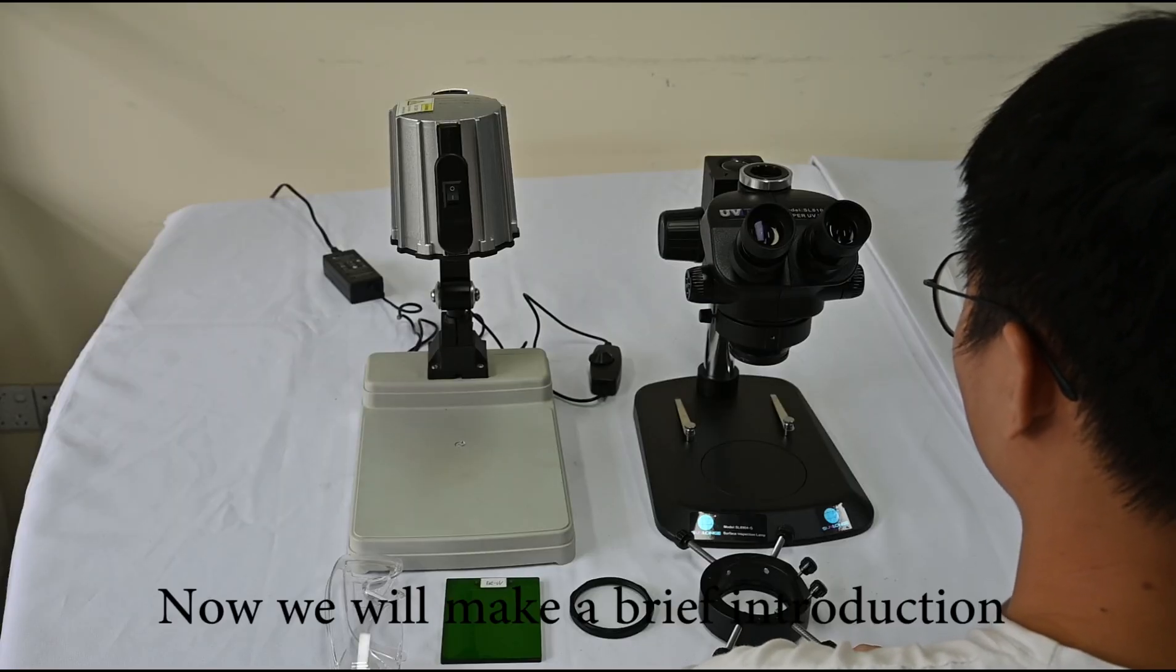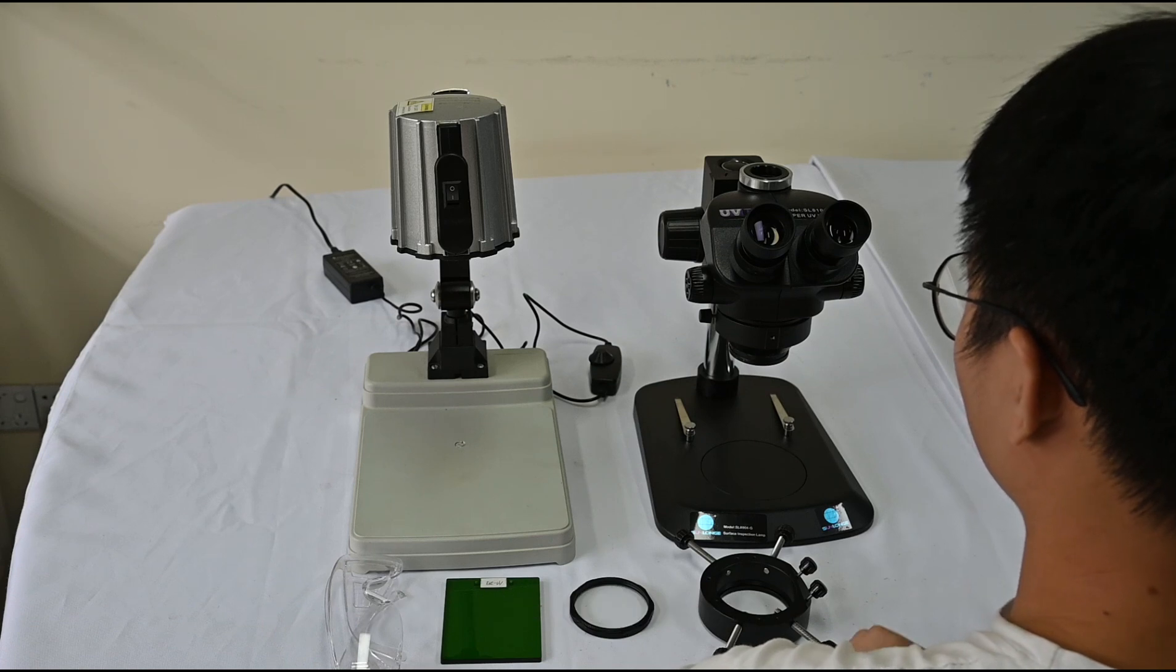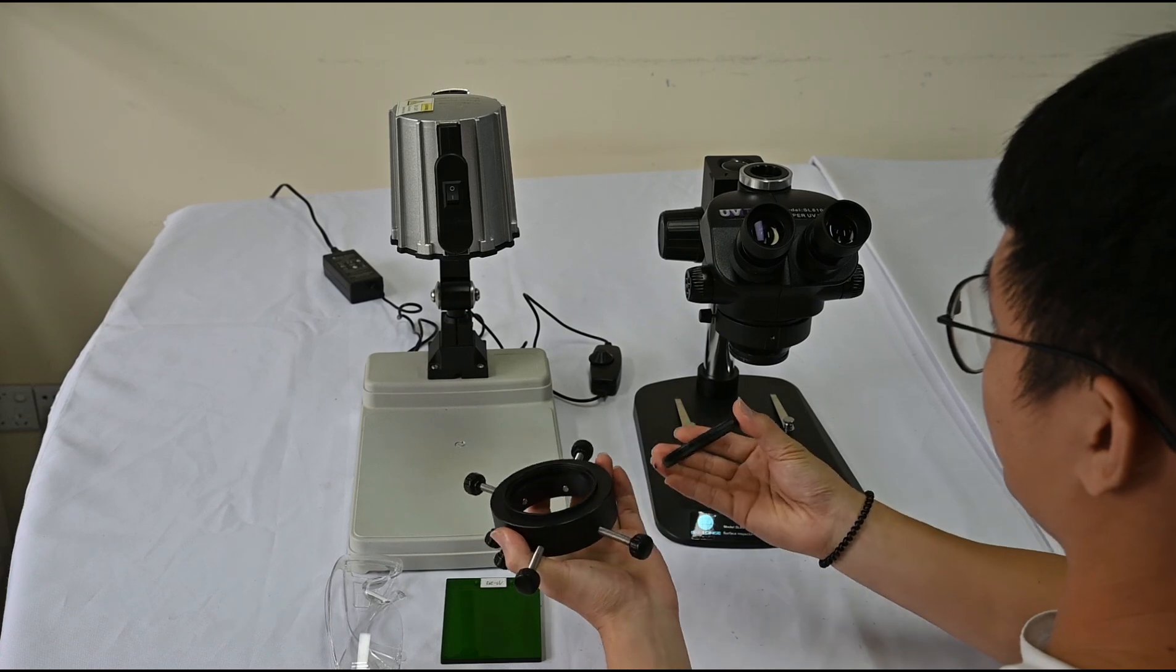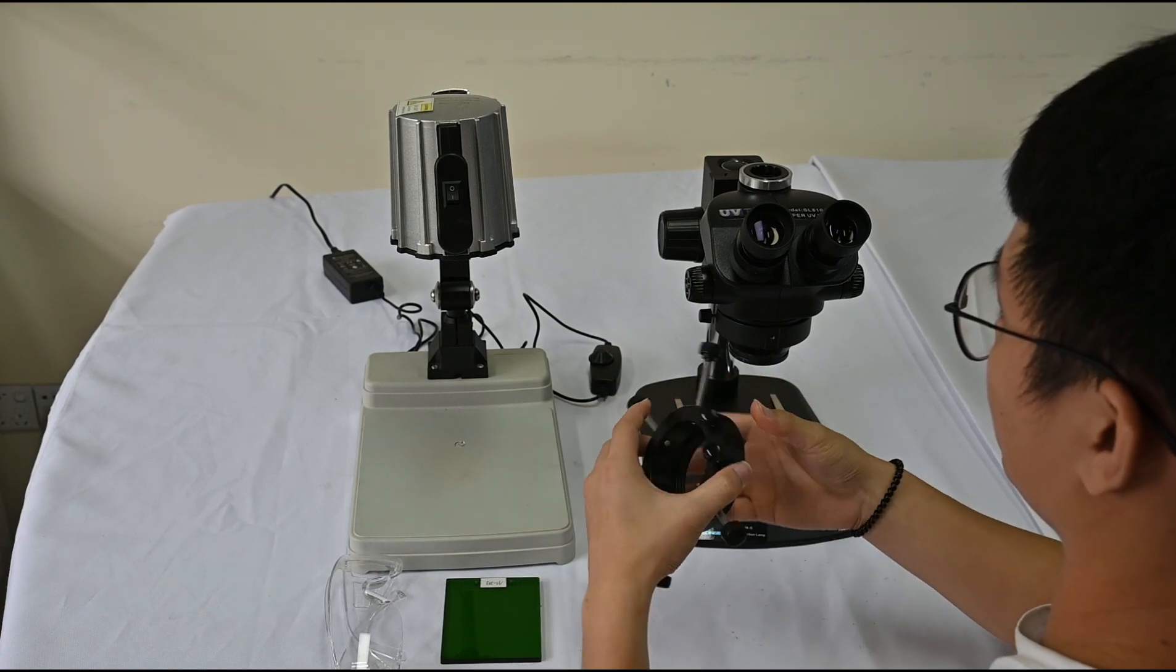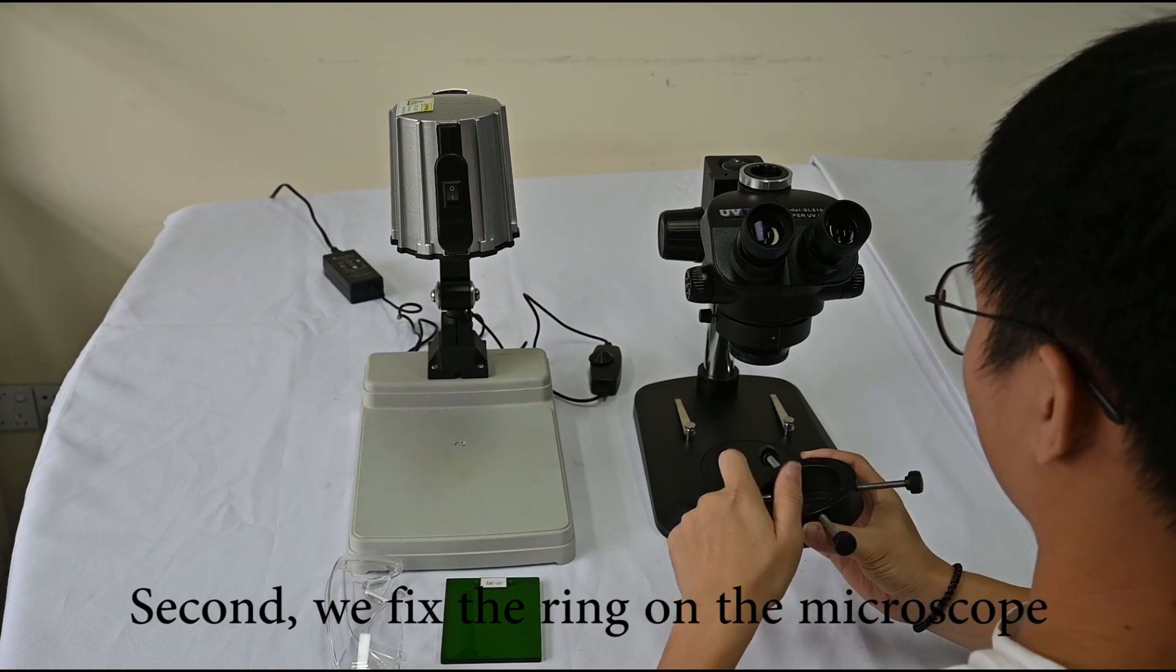Now, we will make a brief introduction about the operation. First, place the filter on the adapter ring. Second, we will fix the ring on the microscope.